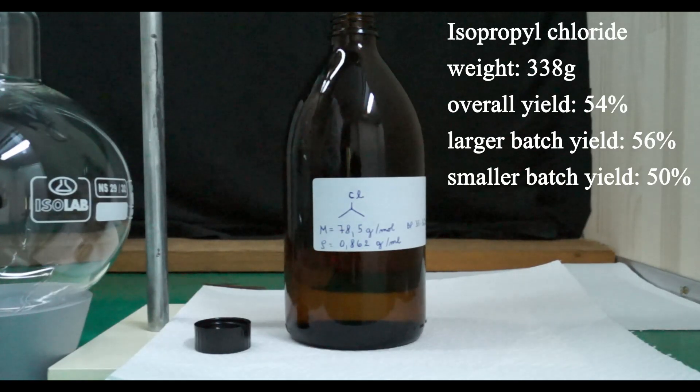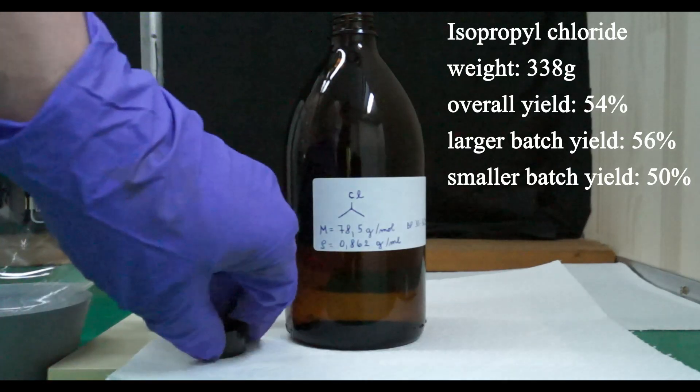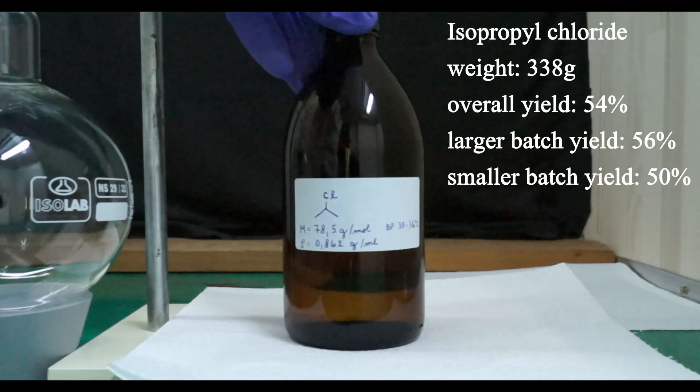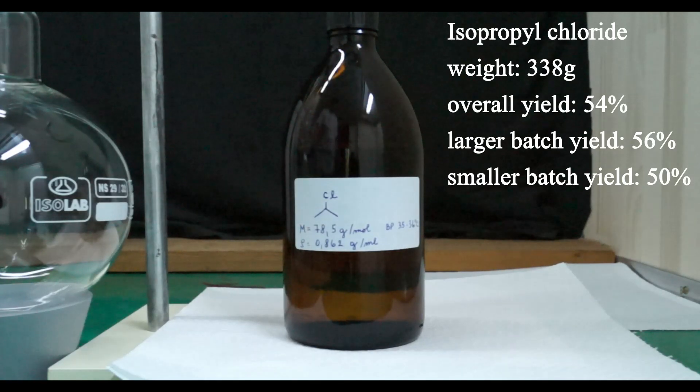Some product was also undoubtedly lost during the first part of the reaction when hydrogen chloride evolution was quite rapid and it carried away some of our product.